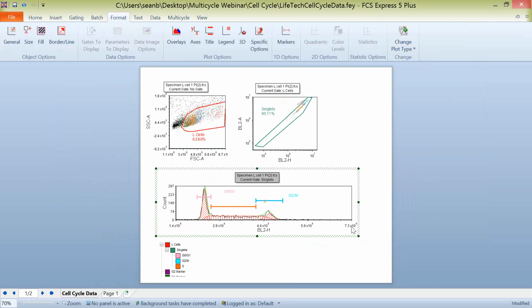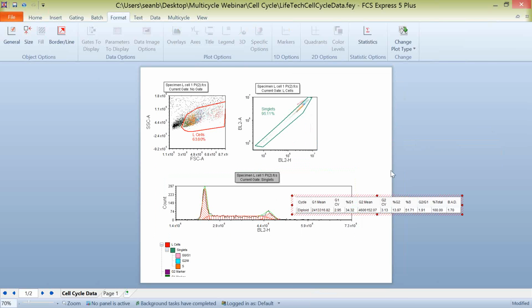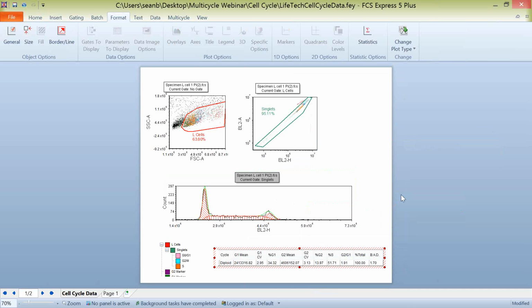When we do so, FCS Express is going to convert that plot to a multi-cycle plot. We'll now no longer be using these G2, S, and G1 markers that we've manually defined because we have a more sophisticated approach for analyzing this data. And you can simply come in here and start grabbing your multi-cycle DNA statistics, and you'll be off and running with your histogram now that you've converted to a multi-cycle DNA analysis plot.